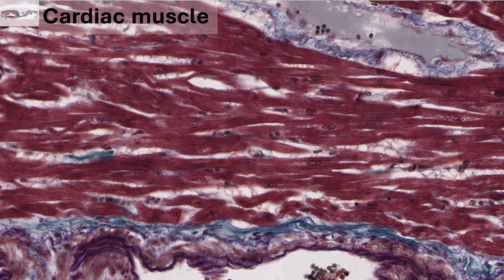The final muscle tissue is cardiac muscle. It shares some structural features with both smooth and skeletal muscle. Its physiology is also intermediate to the other 2 muscle tissues. Like skeletal muscle, cardiac muscle is striated, forming sarcomere units that will contract strongly. Like smooth muscle, the nucleus of a cardiac muscle cell is centrally positioned.